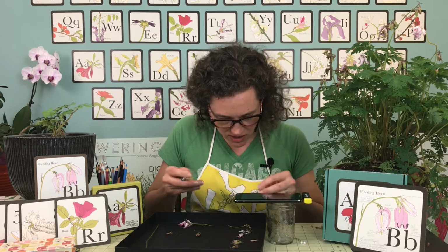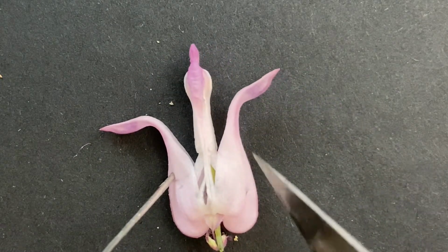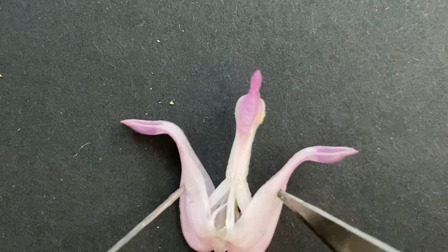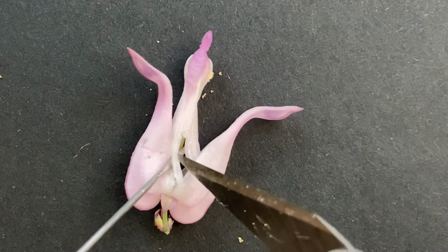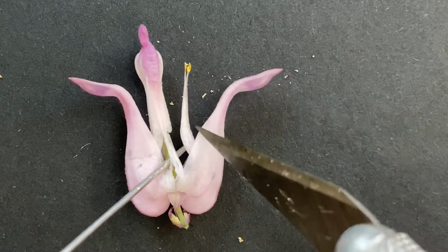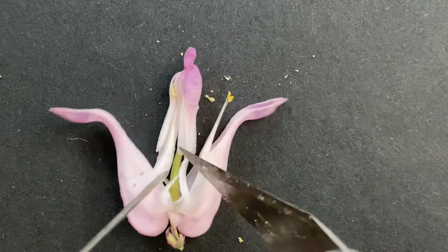All right, so here it is. Let's see if we can separate out all the pieces. So this is like the lady in the bath look. When it starts to open up, you can see inside that ovary. It's nice and large, getting big and green in there. So you see these little pieces right here. Look on the sides. This is the stamens. They're all kind of stuck. And then same thing over here on the other side. The stamens are going to be stuck together.